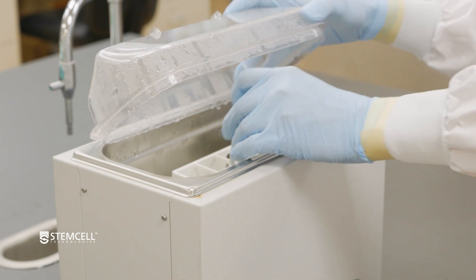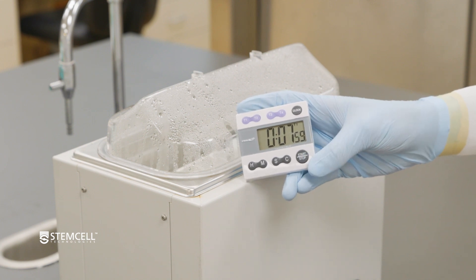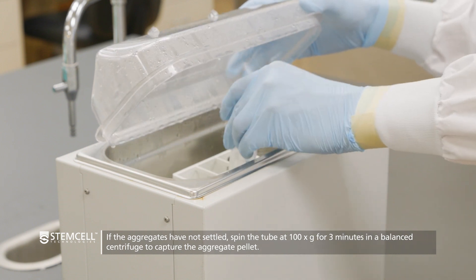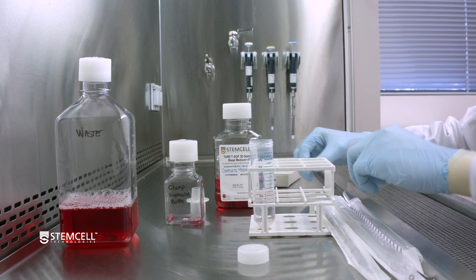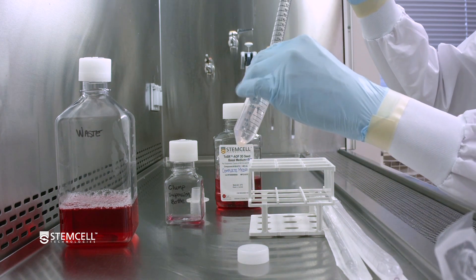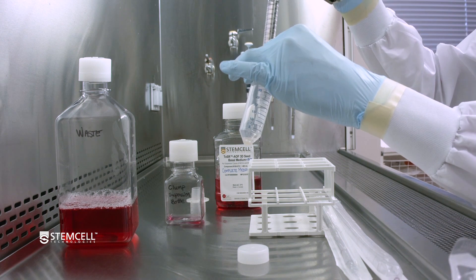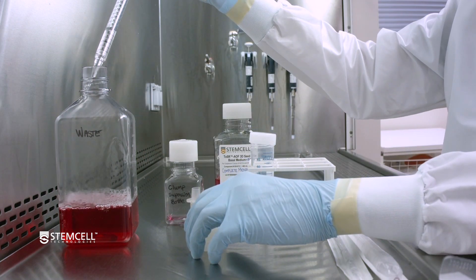Transfer the tube from the BSC into a 37 degree water bath. Incubate the aggregates in the 37 degree water bath for 8 minutes. After 8 minutes, transfer the aggregates from the water bath back to the BSC, being careful not to disturb the aggregate pellet. Next, gently aspirate most of the GCDR from the aggregates, taking extra care not to disturb them. The GCDR can be discarded into the waste bottle.